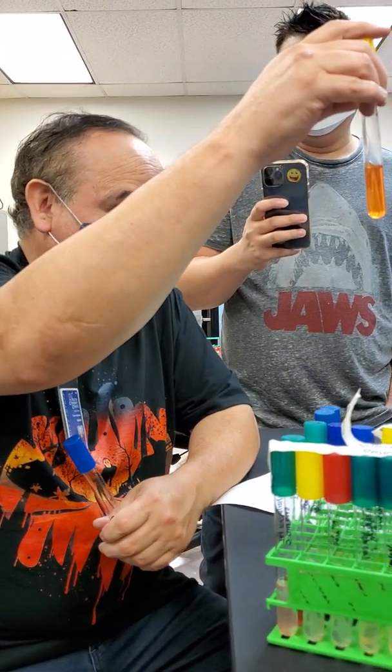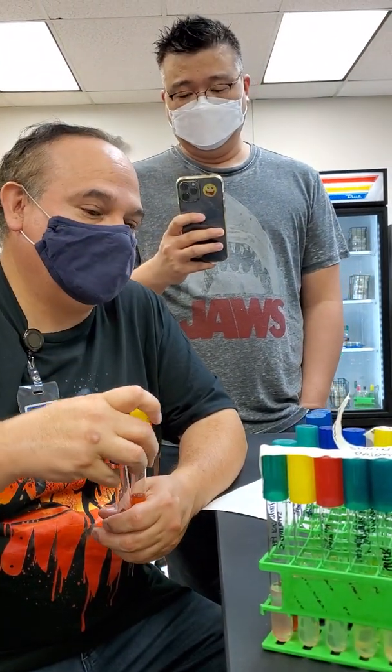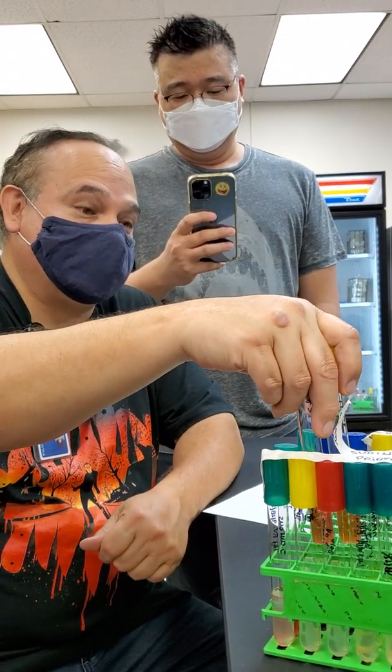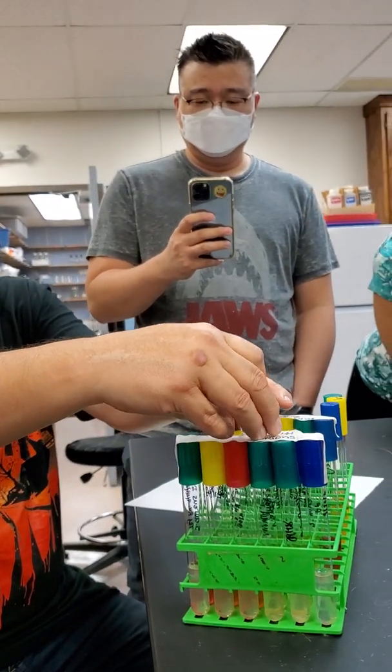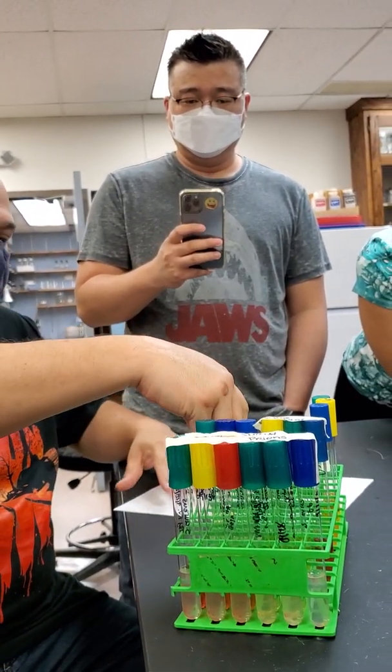Fermentation or not? No, there's just no gas. Acidic. Okay. You two could be microbiologists. All right, so you did a great job. Thank you. Now let's look at the other one.